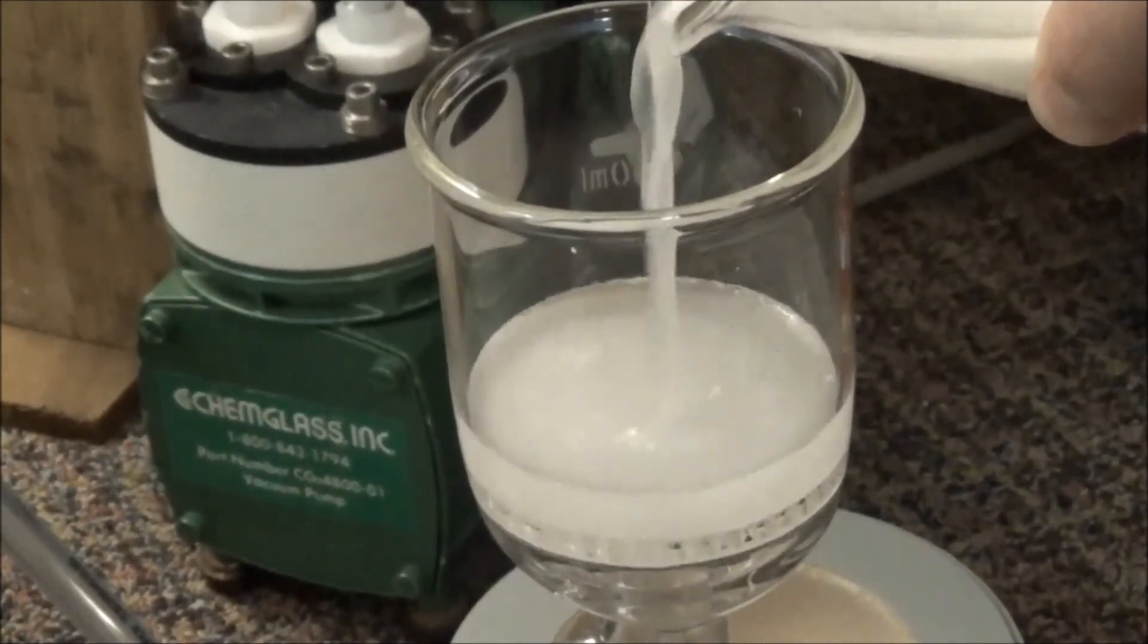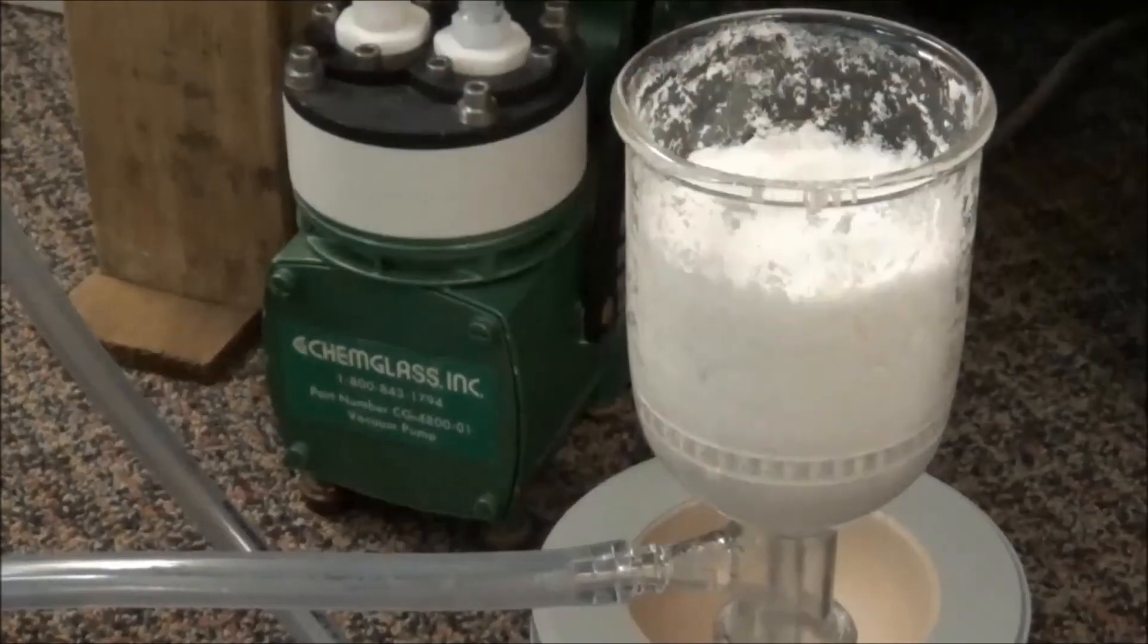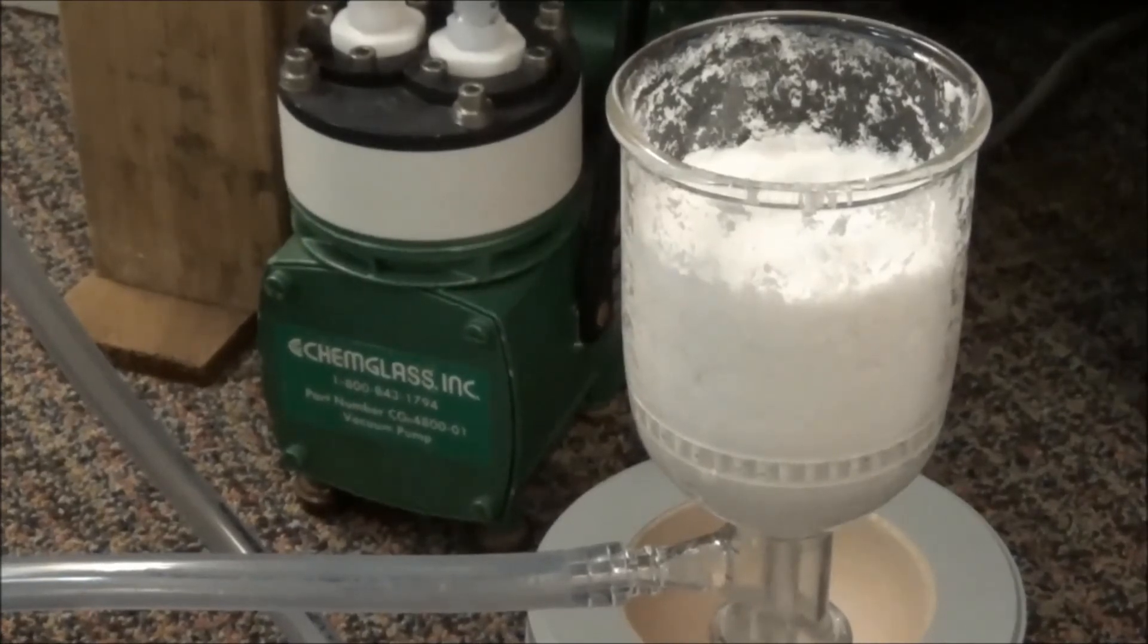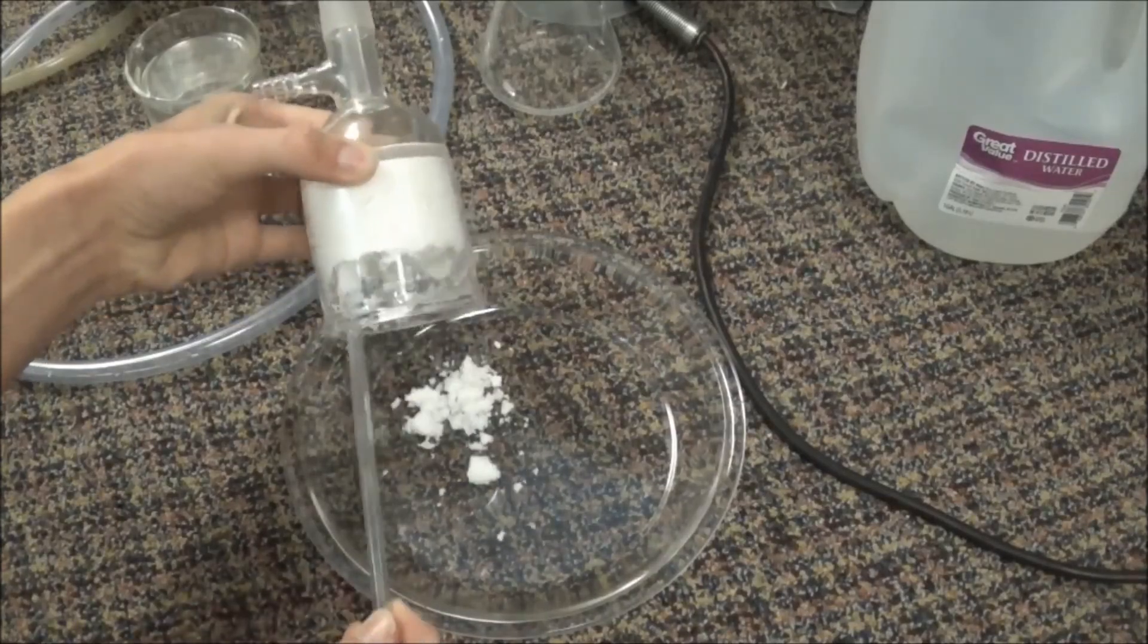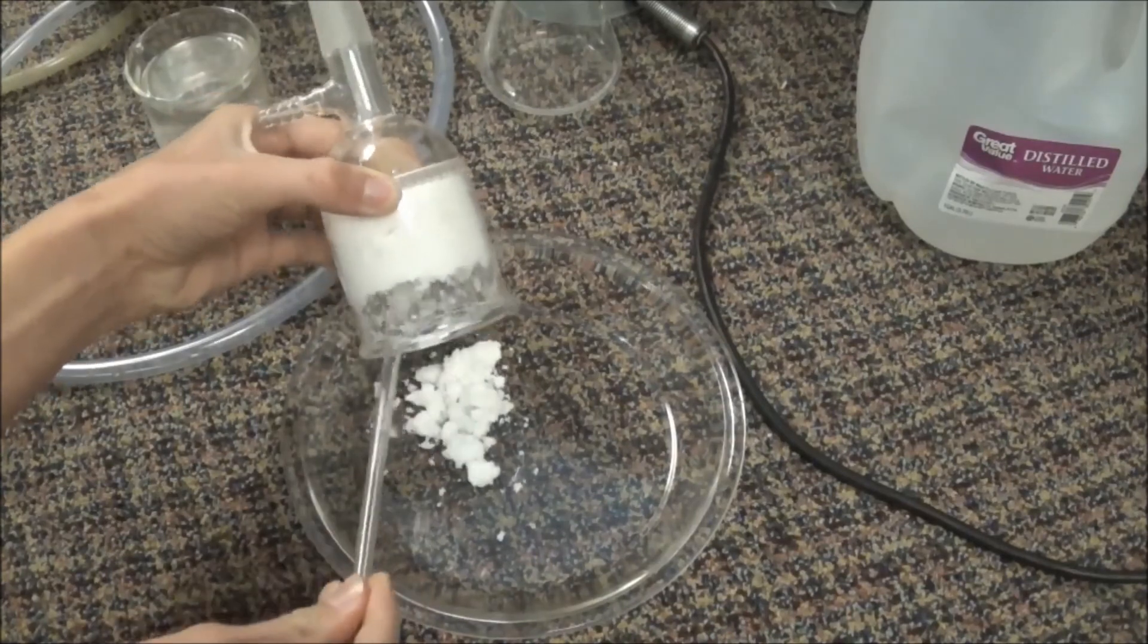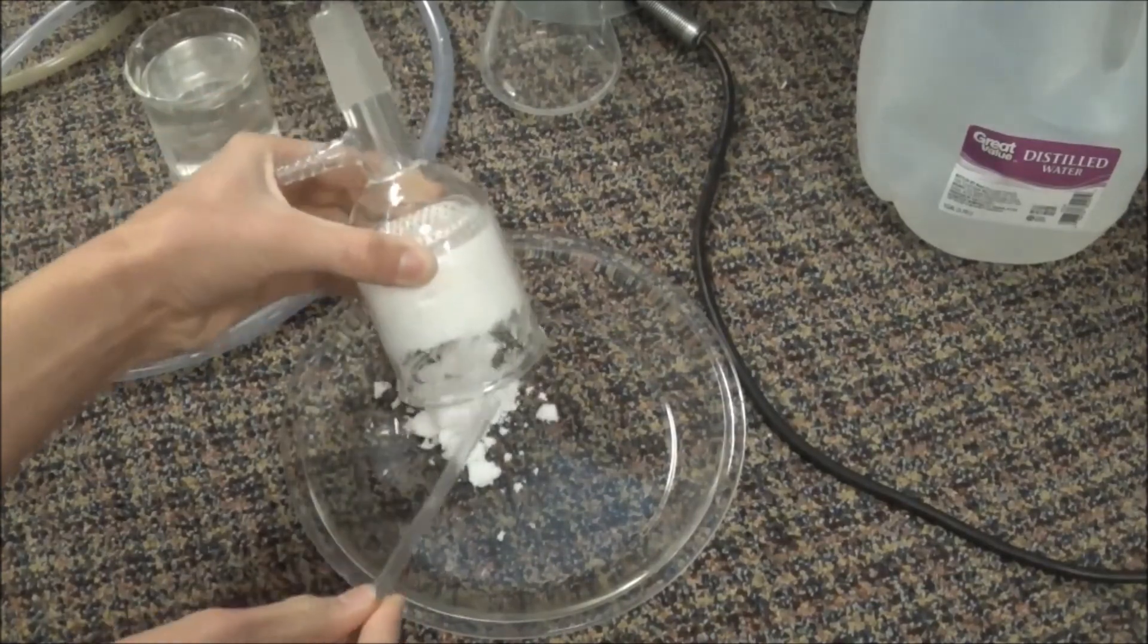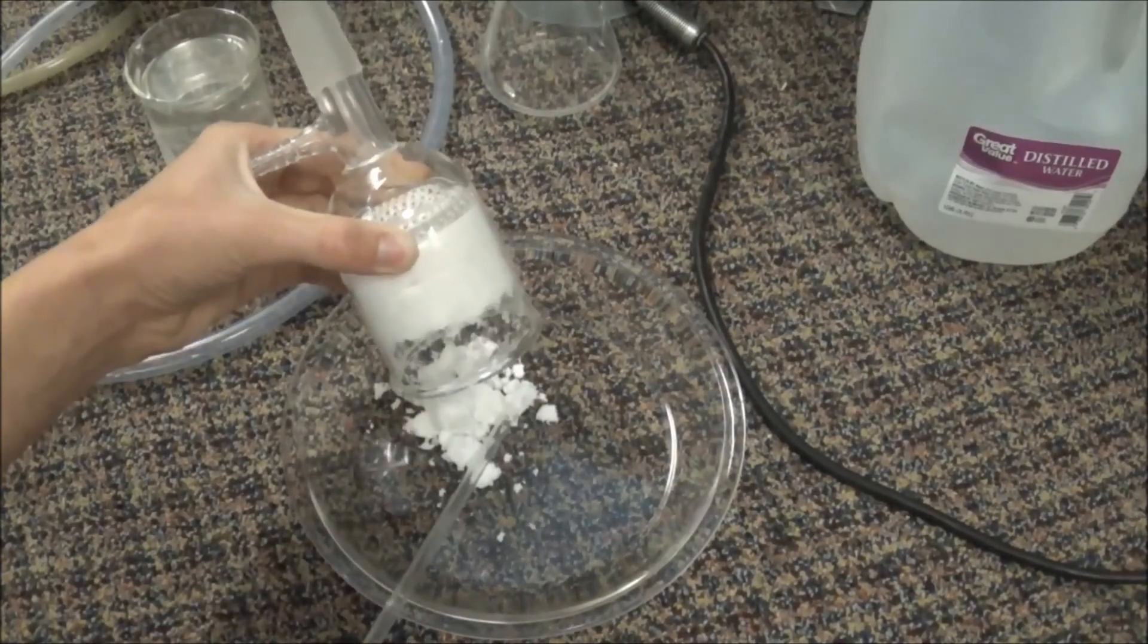Everything was then vacuum filtered and washed with more water. The damp crystals were removed from the filter and left out to dry for a few hours. Eventually, I actually melted them to dry off any remaining water.